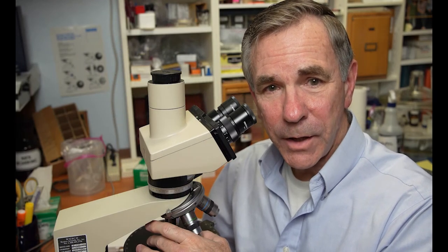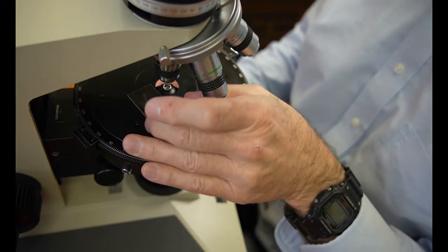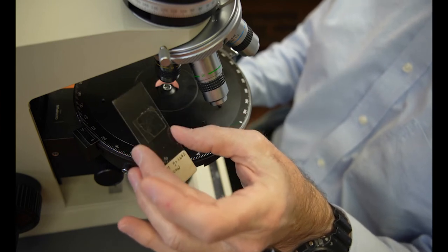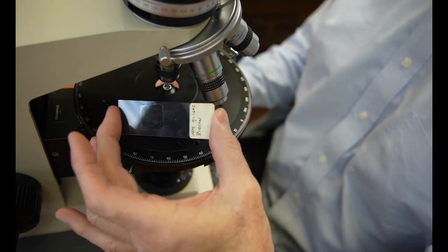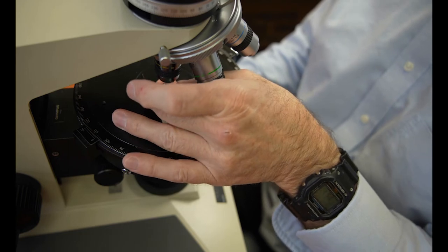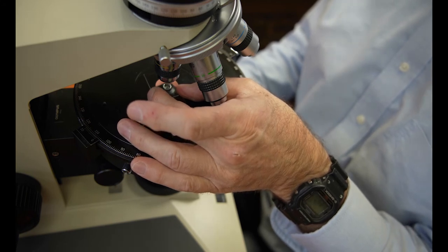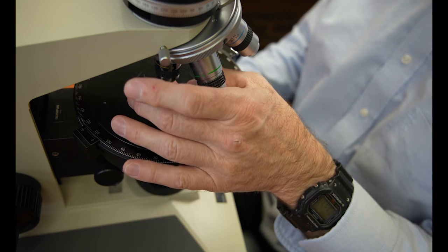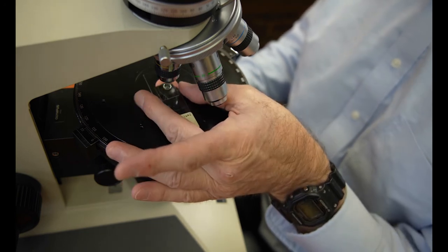So, how do you move the slide if you don't have a mechanical stage once your stage clips are gone? I'm glad you asked. When I'm using a microscope slide, I will generally grab it with my middle finger and my thumb to control it. And you can do it this way, or you can use it this way where you're grabbing the entire length. Sometimes for better control, it's better to have it close to where your sample is. With a little practice, you'll be able to move the slide a few microns at a time. Notice how my little finger and my ring finger and my whole hand sort of cup around the stage, and I'm using the middle finger and thumb in order to move the slide.